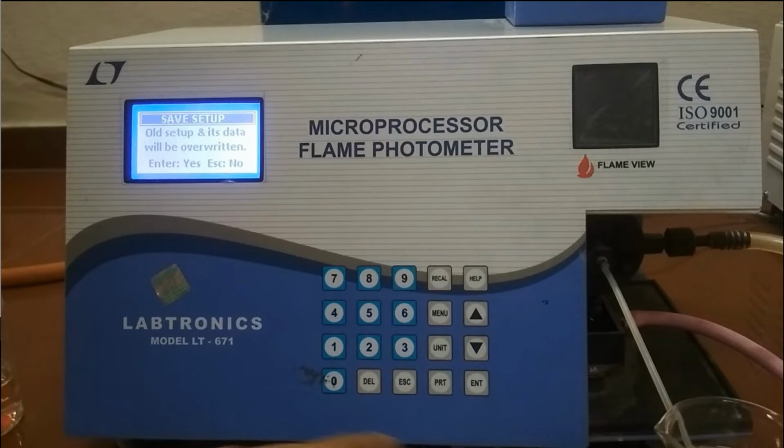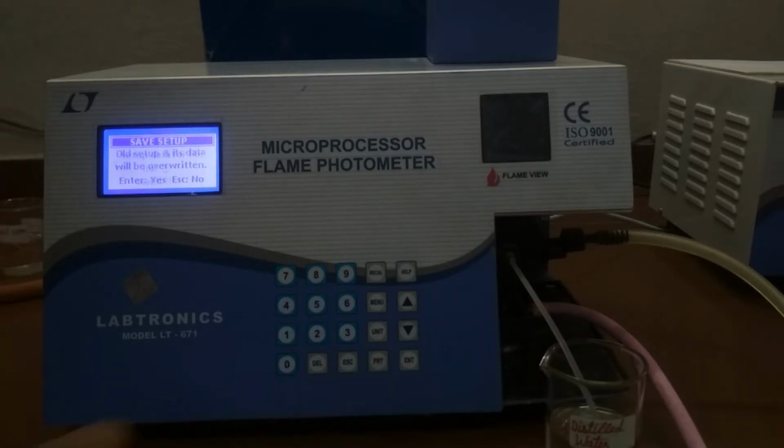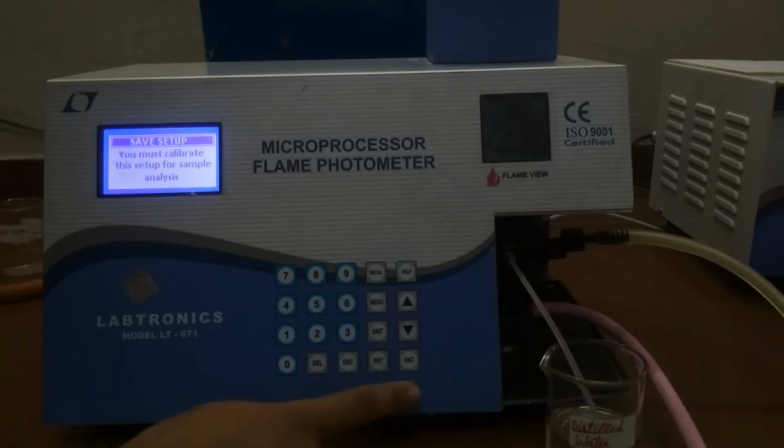The display shows save setup. The old setup and its data will be overwritten. Press enter key if the data entered in the correct setup is to be saved. It will overwrite any data previously entered for this setup. Saving this current setup will also erase any samples that are stored in the memory for this particular setup. Press escape key if the setup was just to be viewed and the old setup data is not overwritten. Since we want to save this data, we will press enter key. After this, the system returns to the main menu.